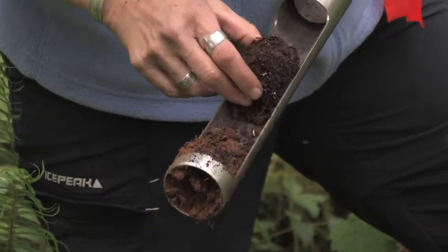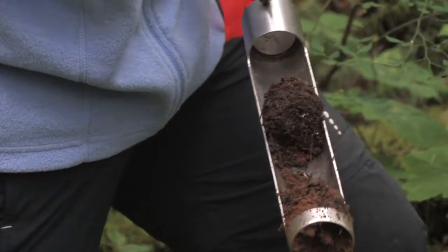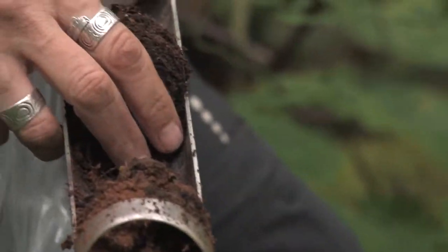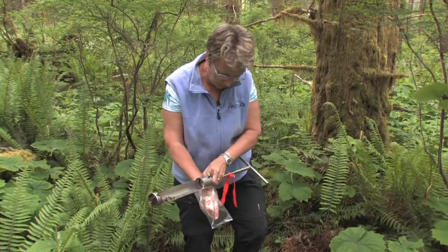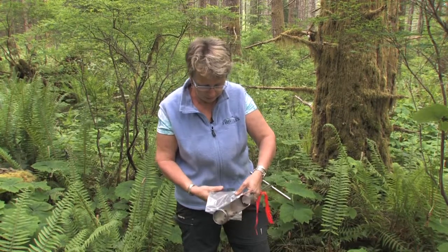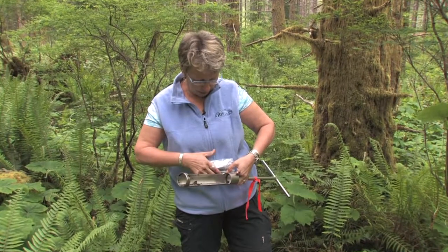I'm going to take off the mineral layer that we have there. As I said, 95% of the fauna are found in this forest floor layer. That will be put in a labeled bag, and again we'll be putting this into the cooler to remain chilled until we get back to the lab and can do an extraction.